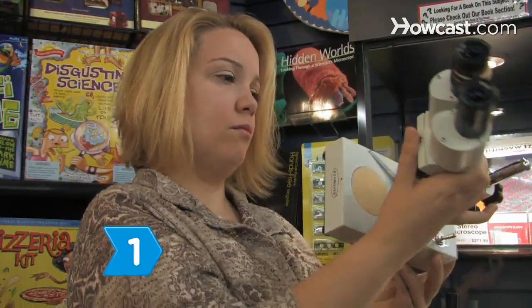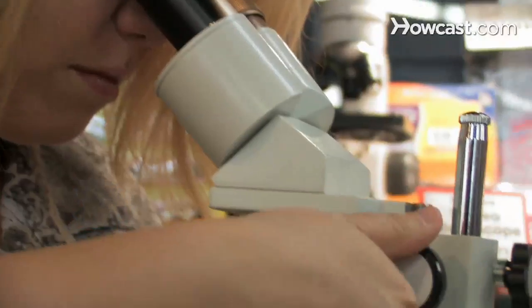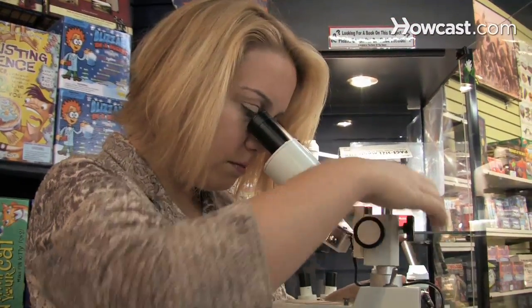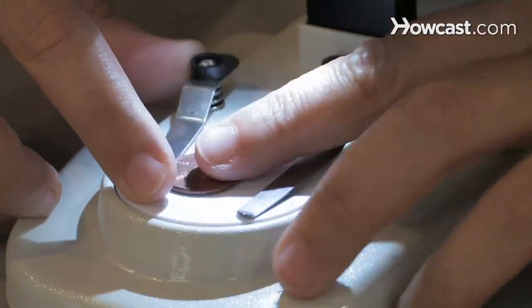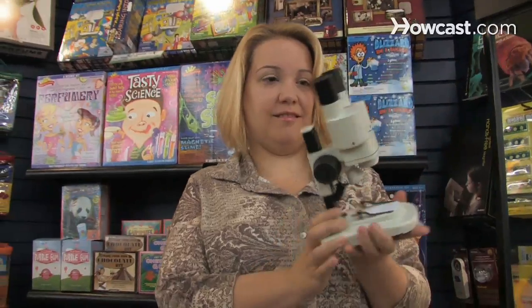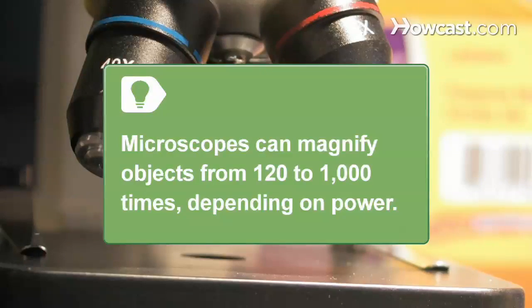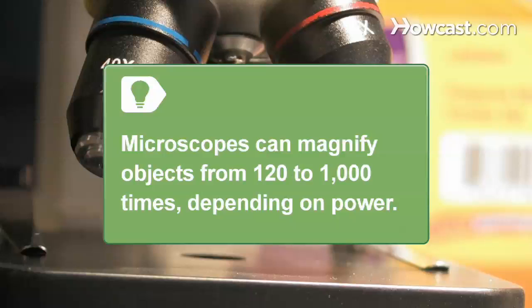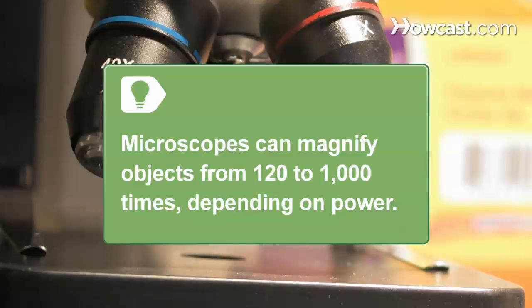Step 1. Determine whether you would choose a microscope for looking at small things and require a high-power model, or larger items like coins and stamps and need a low-power model. Low-power microscopes magnify objects up to 120 times, while high-powered models magnify objects up to 1,000 times.